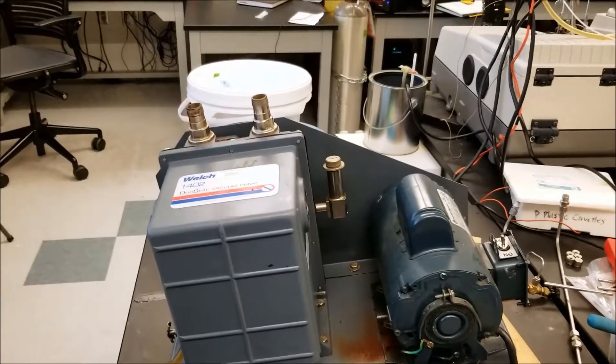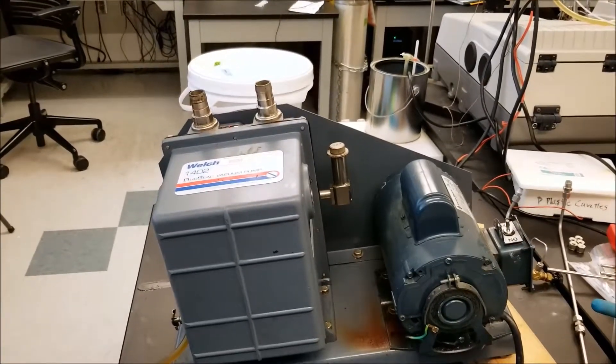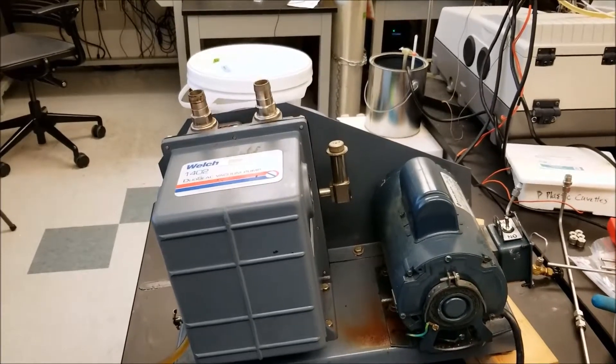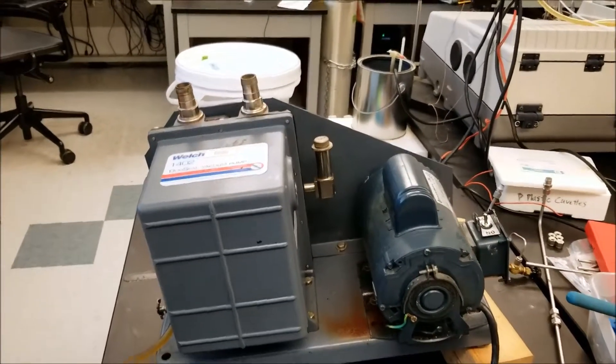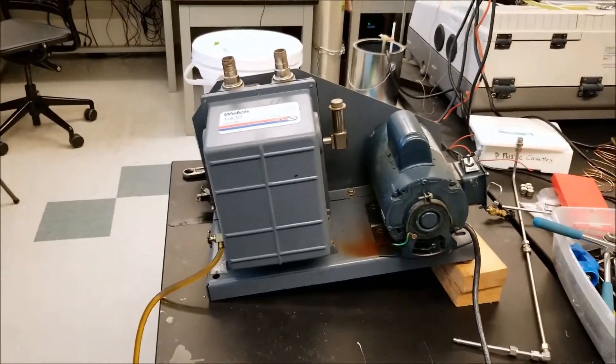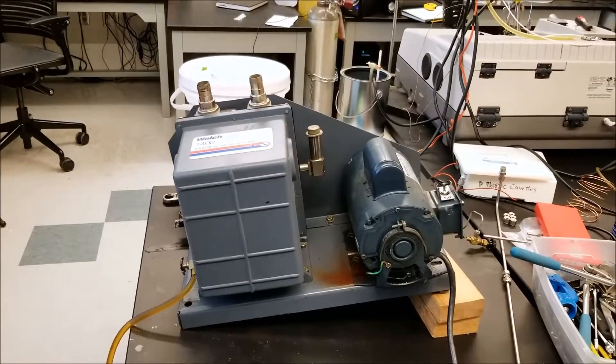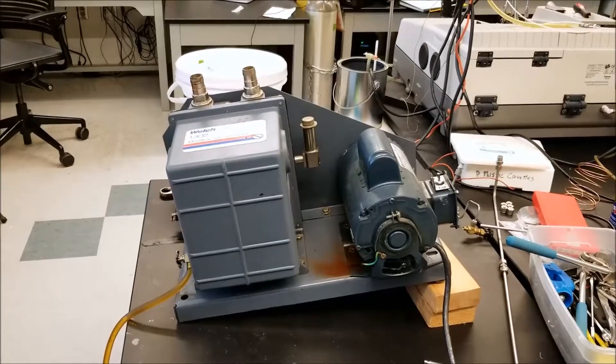But besides that, you may not get it perfectly clear because this is an older pump and we've taken it apart periodically. There's nothing inside that's terribly wrong. Anyway, I continue that, fill the pump back up and then start the system back up.